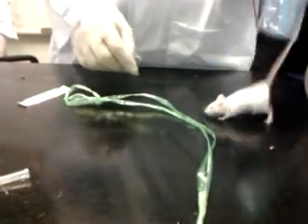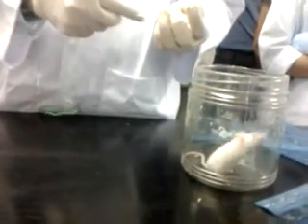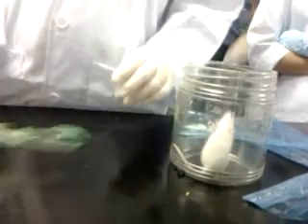It's not good. Too big. No, a smaller one. We just get ready, alright? So easier, faster.